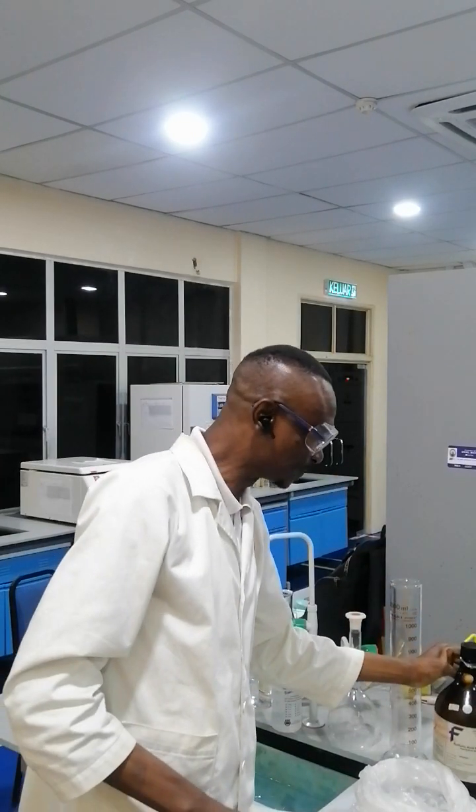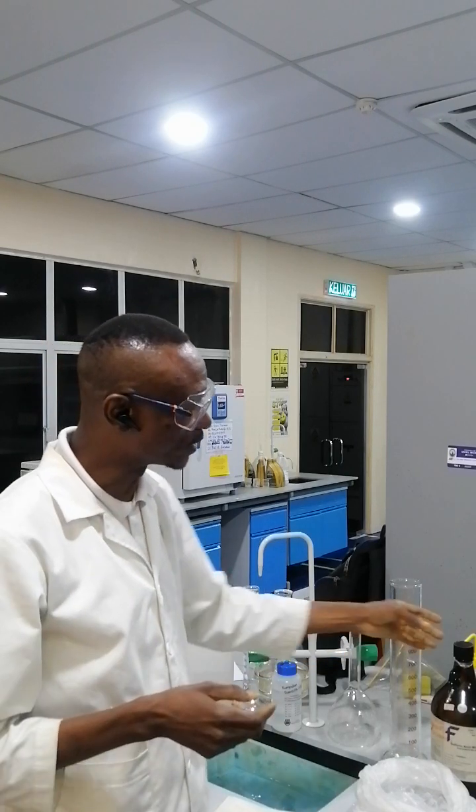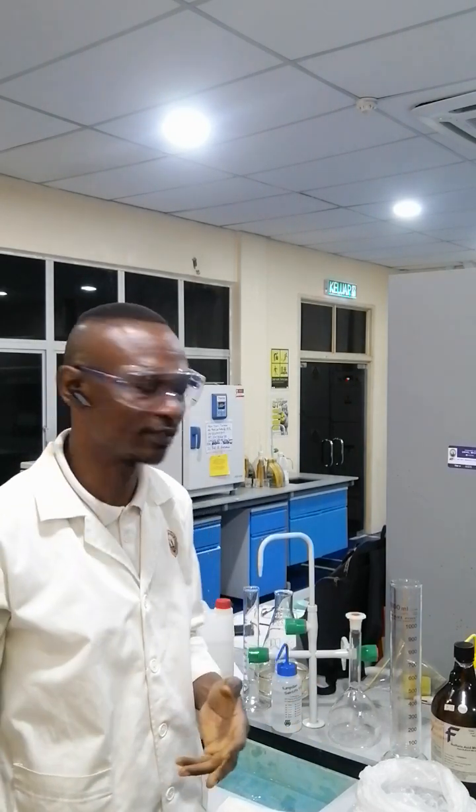How do we do this? We first of all carry out our calculation to know the quantity of the stock acid solution that we will dilute into 1 liter solution to make the required concentration, in this case 72%.